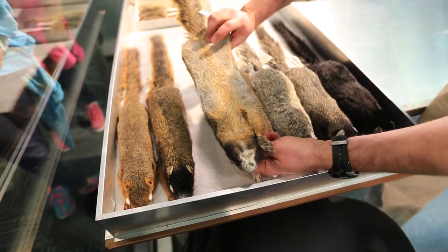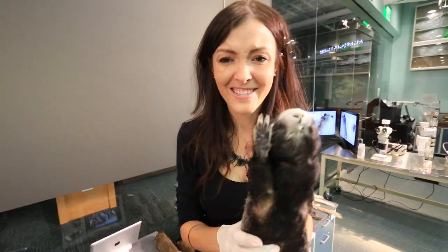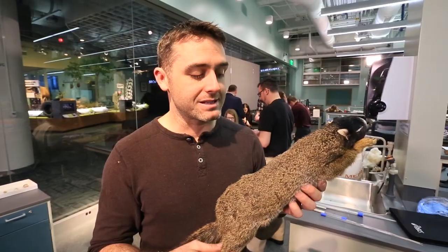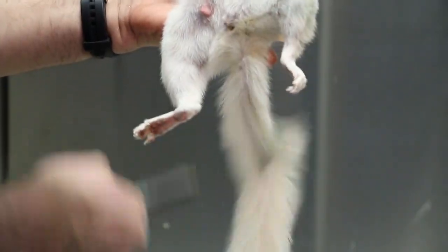The whole reason we're doing this is to create research specimens for the museum that will eventually look like this. This is what we're aiming for — a nice study skin. It just looks so bizarre. But there's a lot of stages involved in getting the sample prepared, so let's start from the beginning.